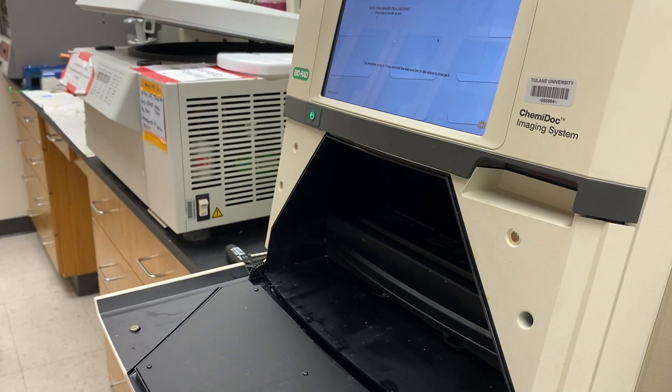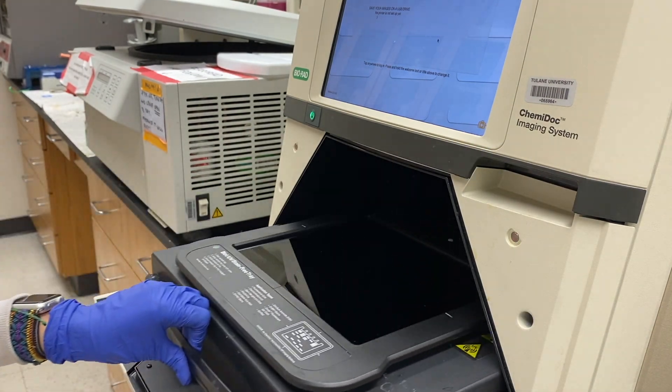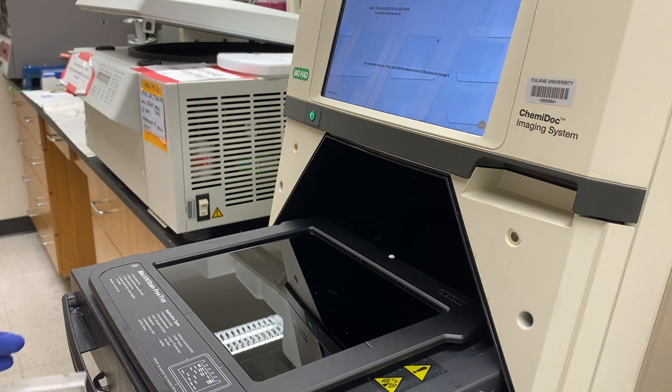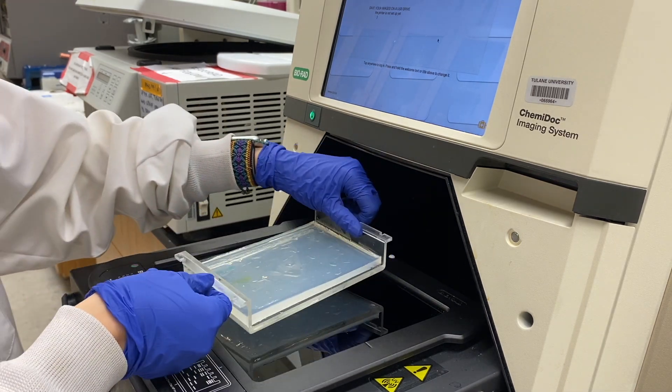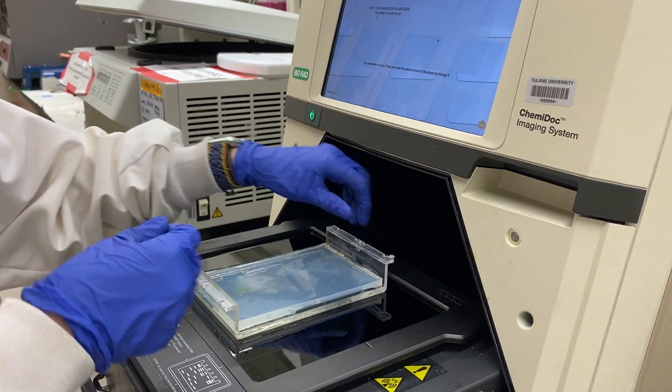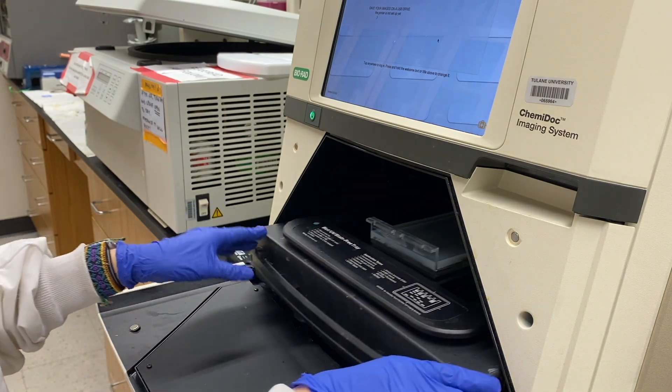I take the finished gel and load it into this machine so it can be read under UV lighting. It's important to note that for this run through, I didn't use the ladder I was talking about earlier, and that's just because this was a sample and I didn't want to waste any of the expensive material.